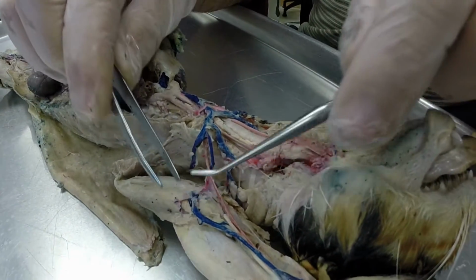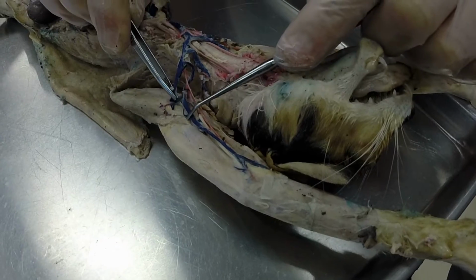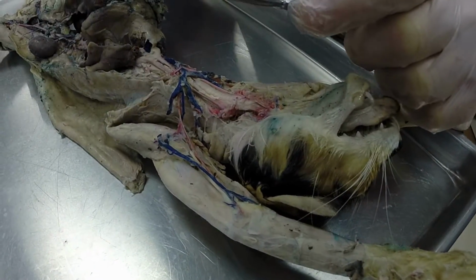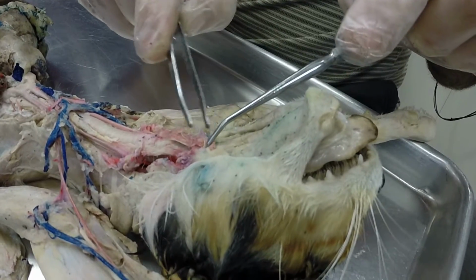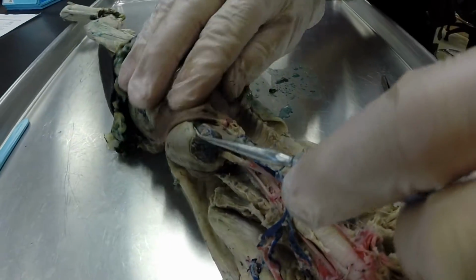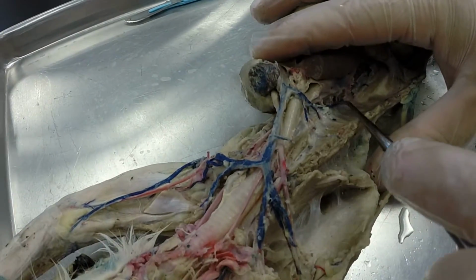And then this one's broken, but the left axillary vein continues down, at which point we call it the left brachial in the arm region. And then when we get to the elbow, we call it the left median cubital vein right there. Okay, we also have our transverse jugular, which is kind of gone on this cat, but it goes across here. Transverse jugular vein. Then we also have, on the right-hand side of the cat, this vein that's coming off the heart and going straight down on the right-hand side. This is called our azygous vein.